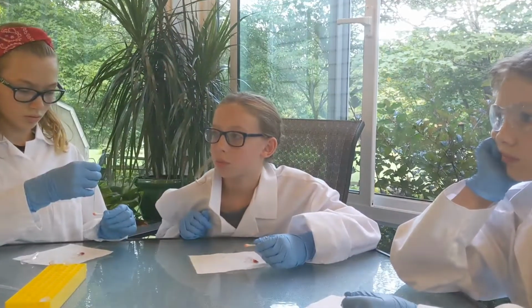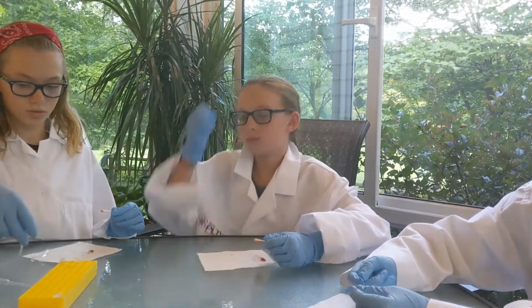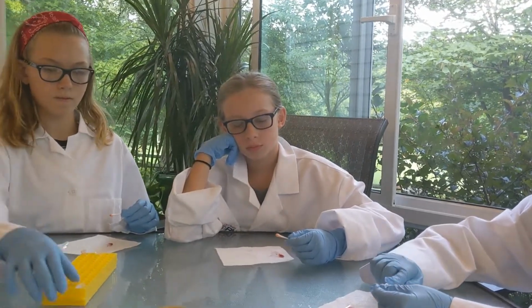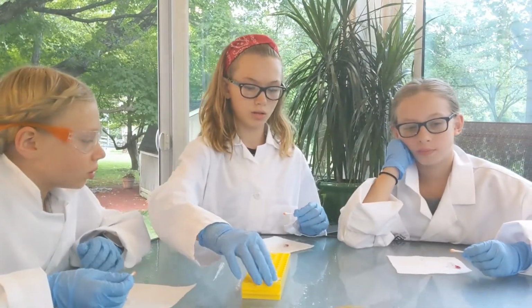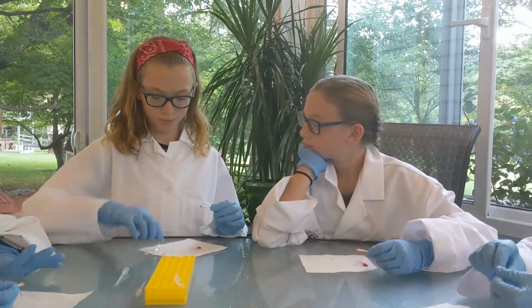Like into the bottom of the vial. Okay. So we're wrapping up our alcohol step, and what's going to come next? Hydrogen peroxide. Almost. That's the very last one. Oh, there was another? Yeah, the P stands for phenolphthalein. Who has phenolphthalein? Okay, great.